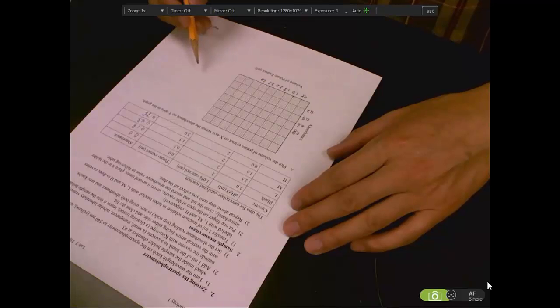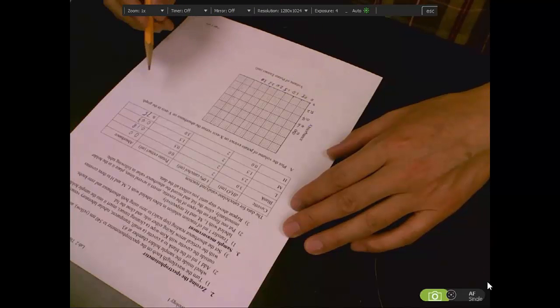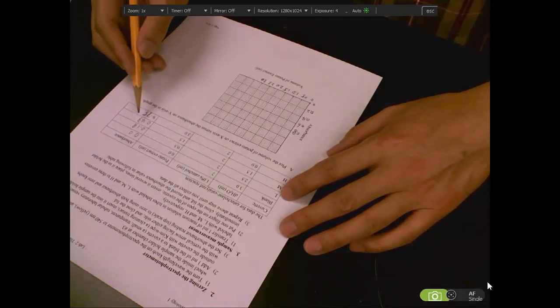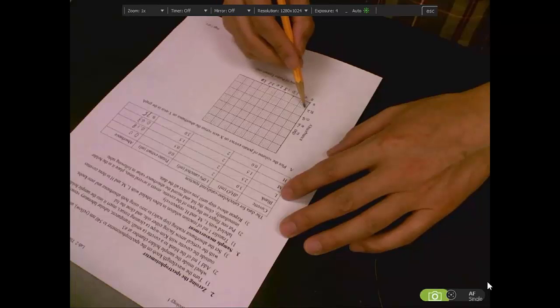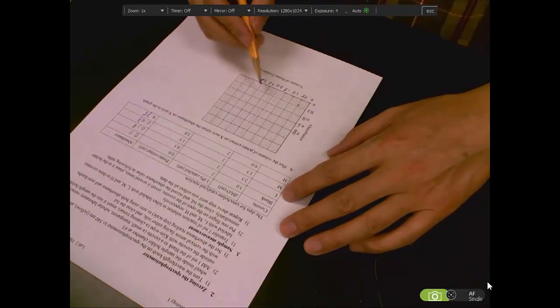Let's put the first dot on this chart. The first one is 0 and 0, so both are 0. Then the second dot is the one with the lower concentration. The volume is 0.5, so 0.5 and 0.18, close to 0.2. That's the first dot.